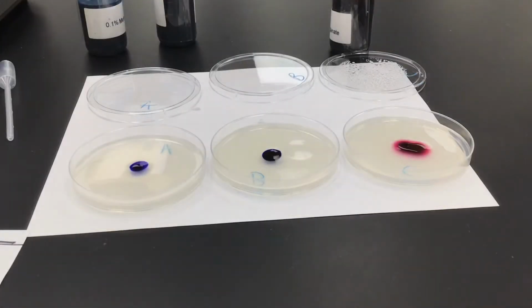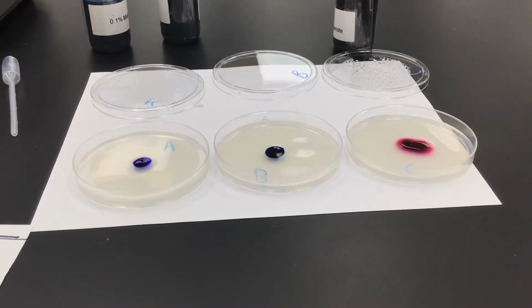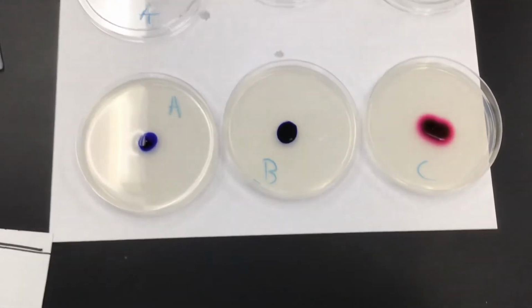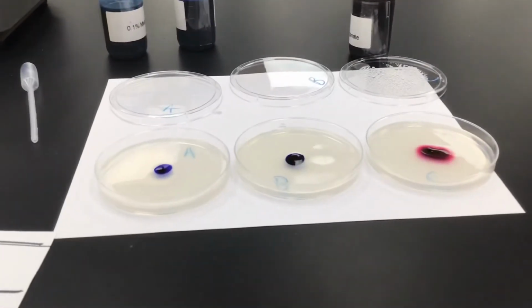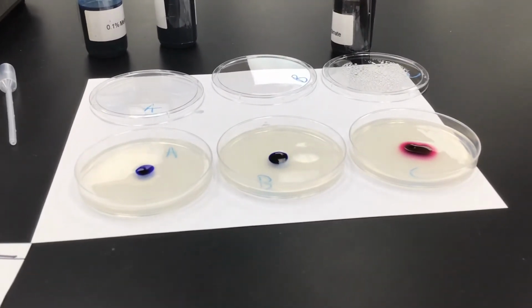We made it to the 30-minute mark for reviewing the molecular weight, activity, and concentration gradient. So you can see our different dyes, and we're going to measure them. So we're going to give you an overview. See, they're not moving too much over time. So remember that. So let's measure them real quick.